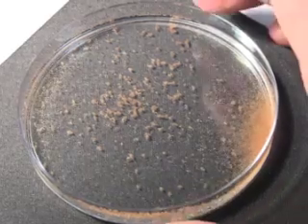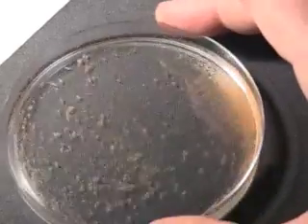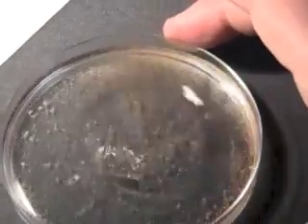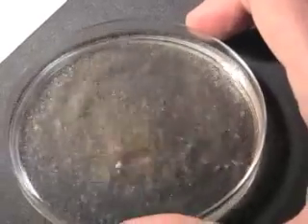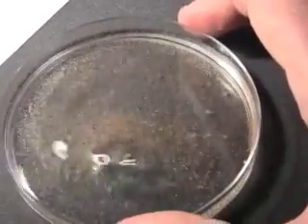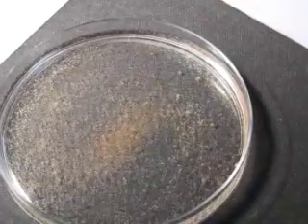What you do is agitate the sample. This will break up the swarm and homogenise it, so you'll be able to get a representative grouping of live and dead Artemia.